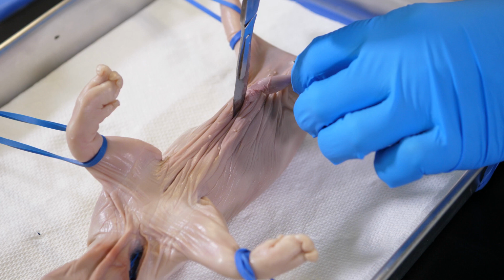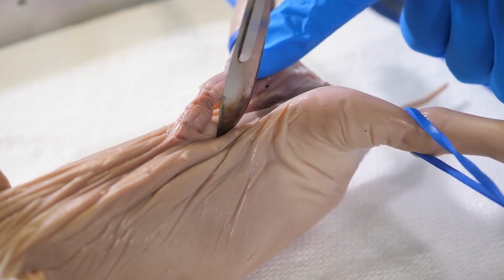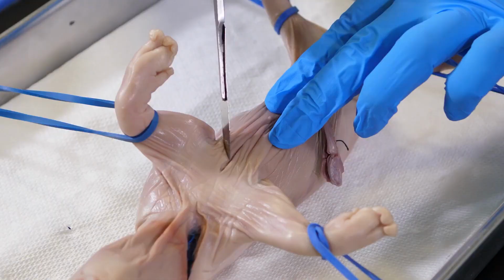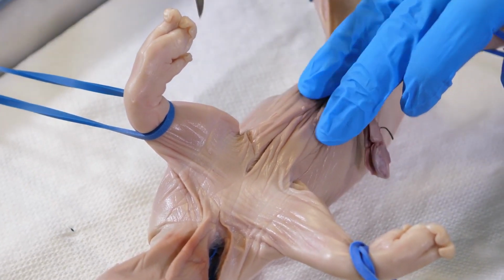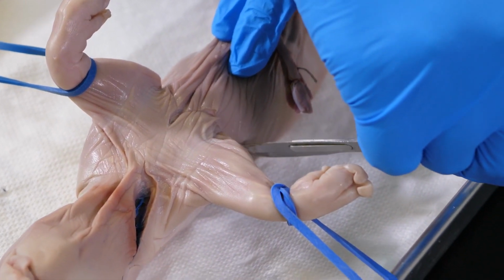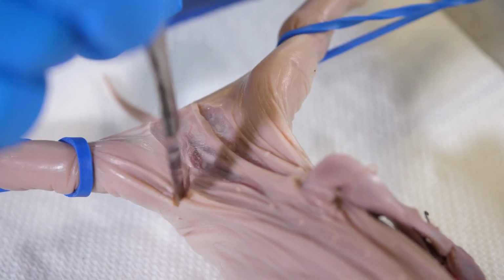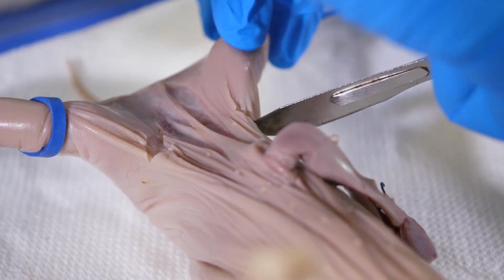However, caution must be taken when cutting the skin posterior to the sternum, because we could cut too deeply and damage internal organs. We need to cut around the umbilical cord on both sides. Using the scalpel, we will make 4 shallow transverse incisions. We begin at the anterior end of the medial incision and cut diagonally, just posterior to the foreleg. This incision is repeated on the other side. Next, we make a transverse cut just anterior to the hind leg, starting at the medial incision. This incision is repeated on the other side.